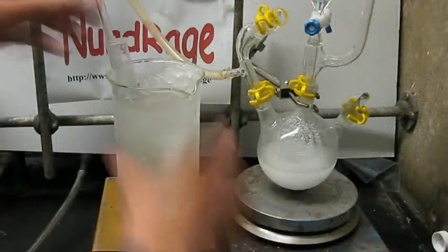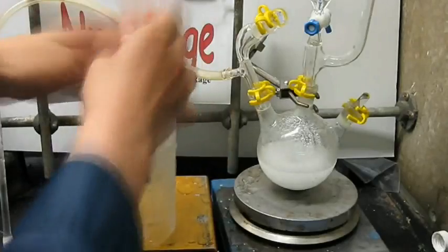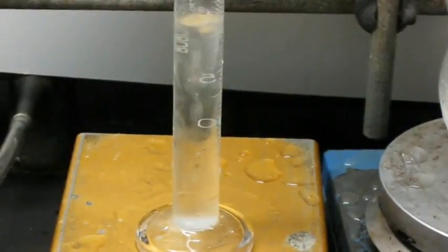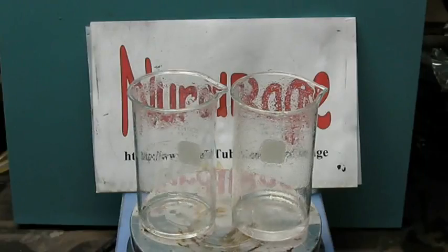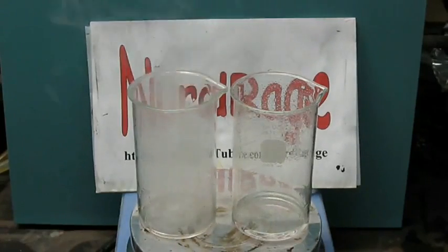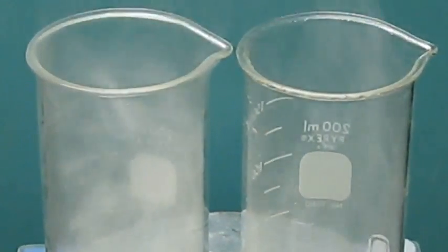Alright, in either method, take out the cylinder from the ice bath and let it warm back up to room temperature. As it does so, some of the excess sulfur dioxide will bubble out. Boil the acid to both concentrate it and remove the remaining sulfur dioxide. As the concentration rises due to loss of water, the acid itself will eventually start to vaporize, producing a very distinctive fuming as seen here.